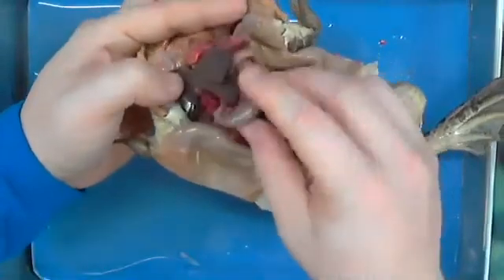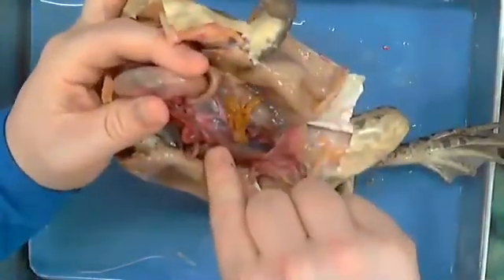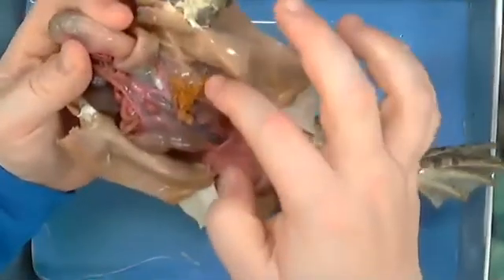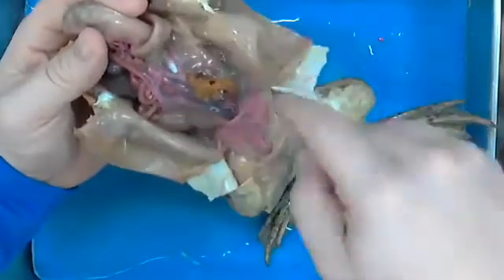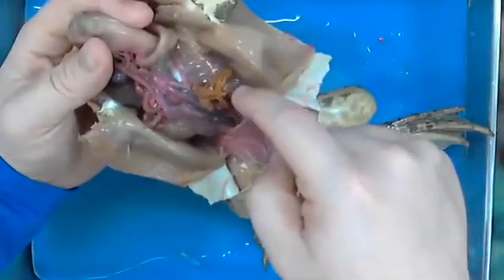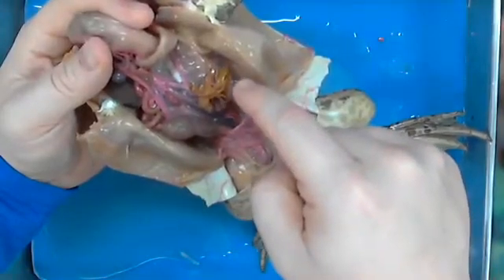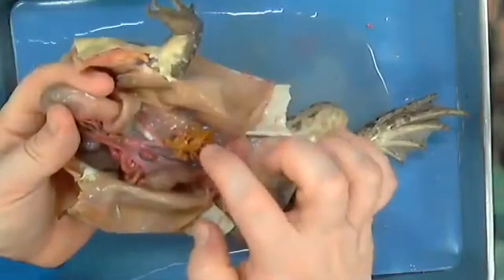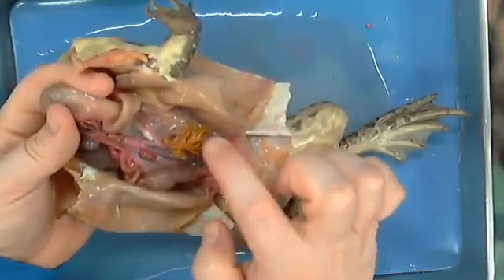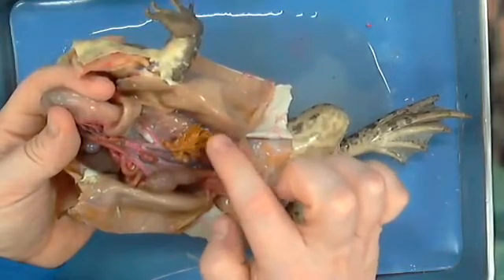Okay. So real quickly, I want to show you, if I can, I'm going to try to find it so that everybody can see. By the way, anybody happen to know what these are called? If you didn't look, they were in your notes. Anybody know? Hey, your camera cut out for half a second, and then you were touching that thing. Where are you at right now? All right. Yeah. So, hey, what is this thing called, by the way? Spleen? I don't know. It's nasty.